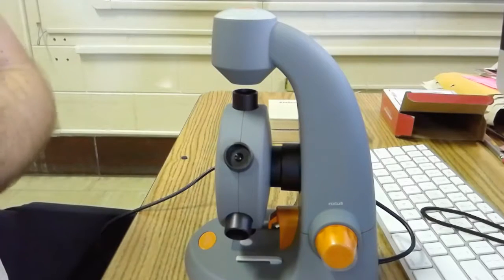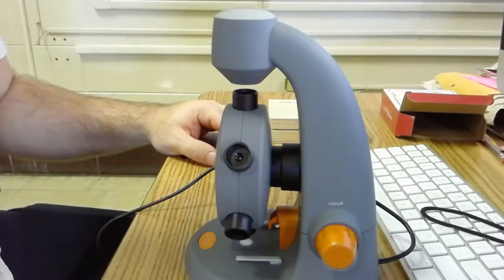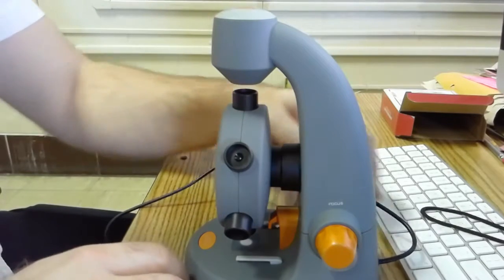Okay, so this is a video showing you how to use the digital microscopes for the first time, just simple startups for them.